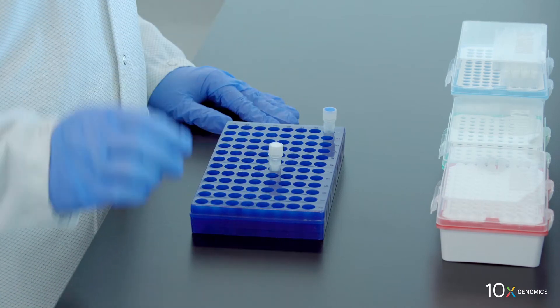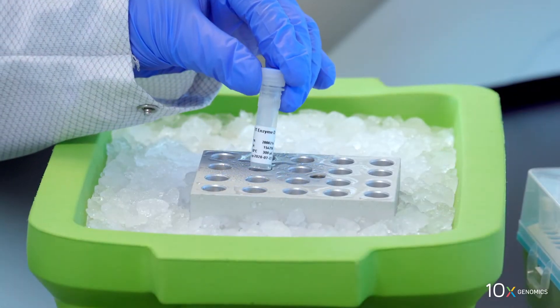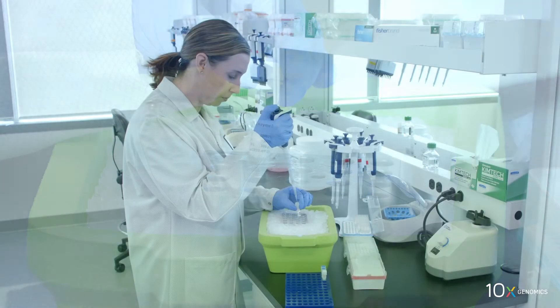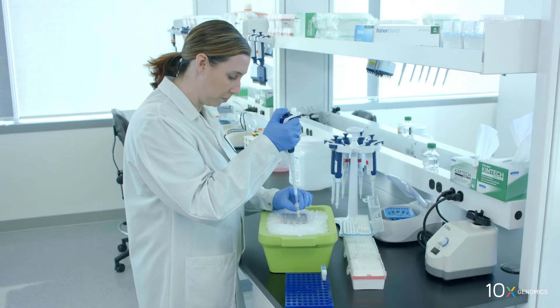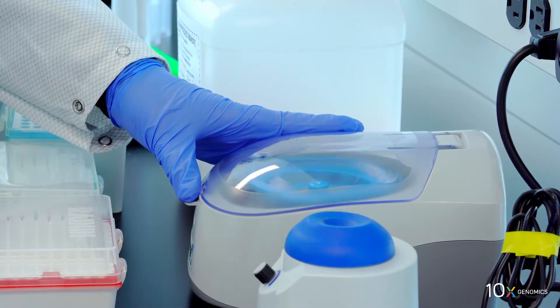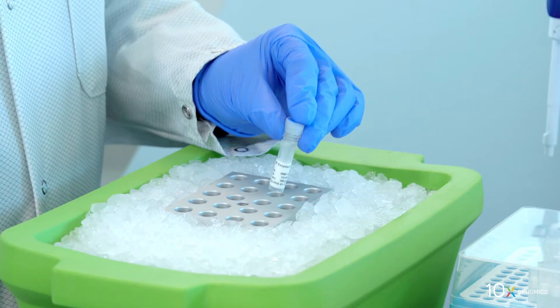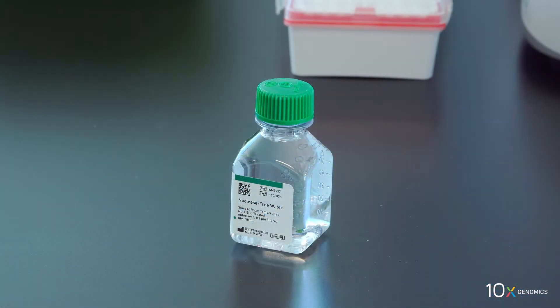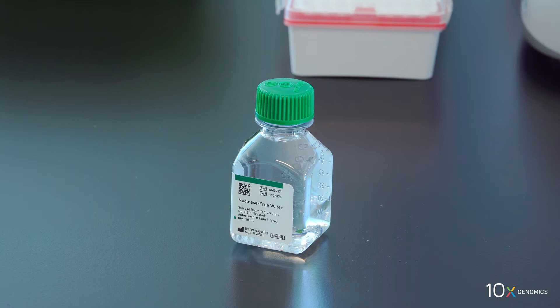We have RT enzyme D: pipette mix, spin down briefly, and place on ice. Finally, we have nuclease-free water. Next we will prepare the RT master mix on ice. We will add the reagents in the order listed in the user guide.